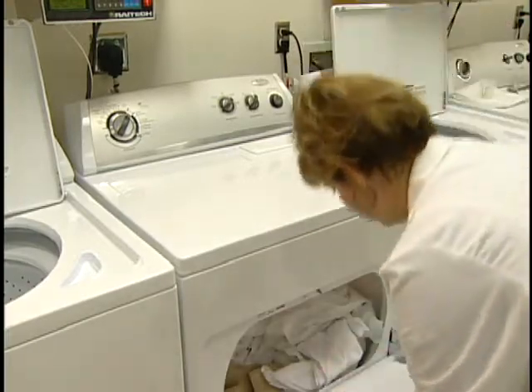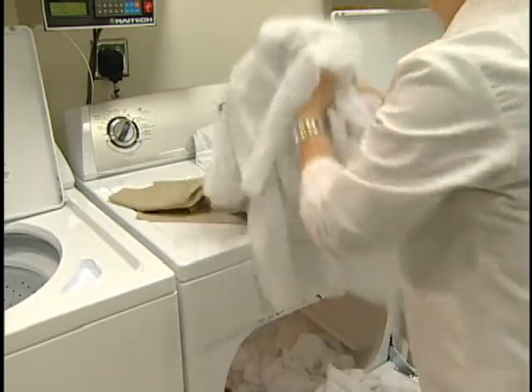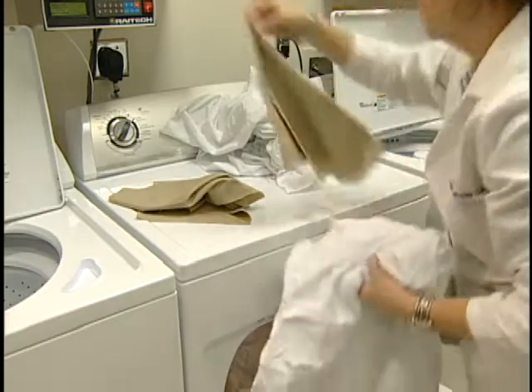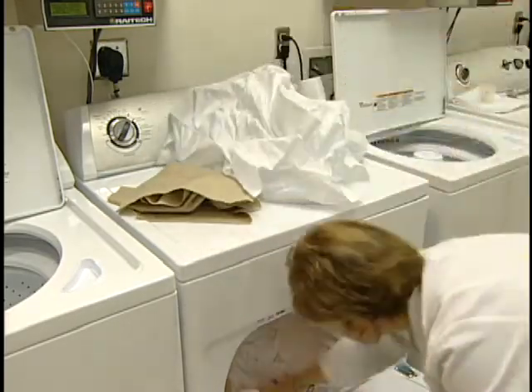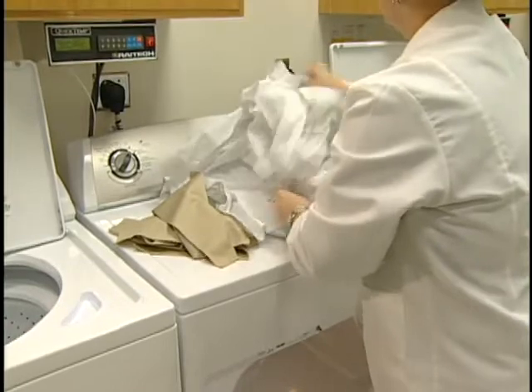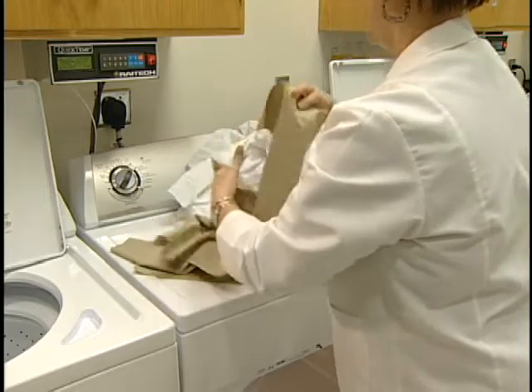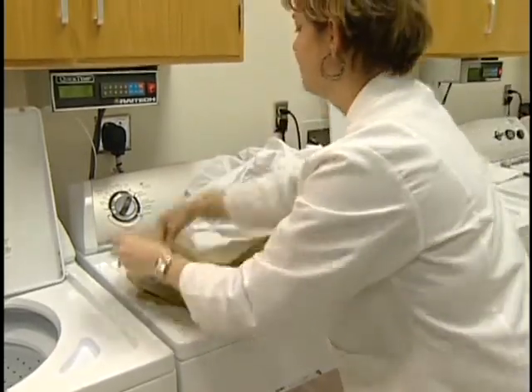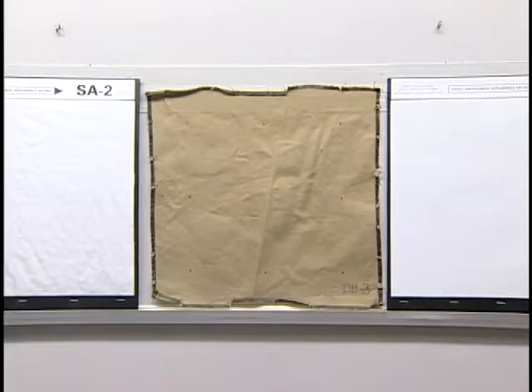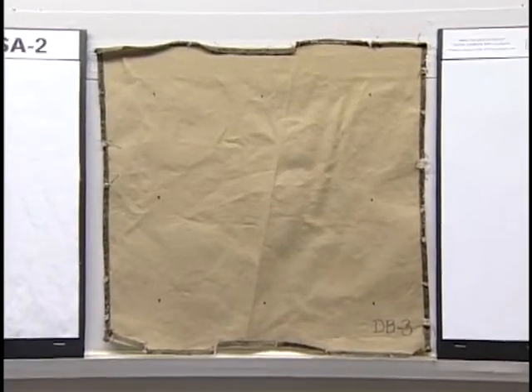If the specimens are to be tumble dried, allow washing to proceed automatically through the final spin cycle. Remove the test specimens immediately after spinning. Separate tangled pieces, taking care to minimize distortion, and dry to the specified temperature. For fibers that are heat sensitive, lower temperatures consistent with producer's recommendations are required and must be reported. Operate the dryer until the total load is dry and remove the load immediately after the machine stops. Over drying must be avoided. The small size of the specimen will occasionally cause wrinkles or creases in the dryer, and these effects are not considered characteristic of fabric performance in actual care and use. Precautions are given in the test method to reduce the occurrence of dryer creases.